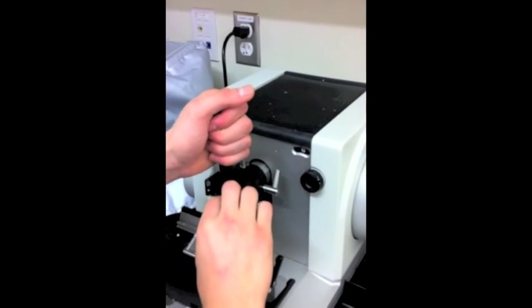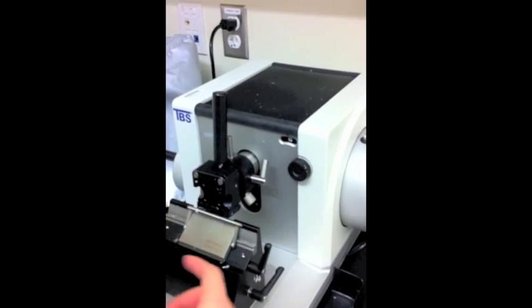After you have locked the wheel and secured the finger guard, you can remove the cartridge from the microtome.